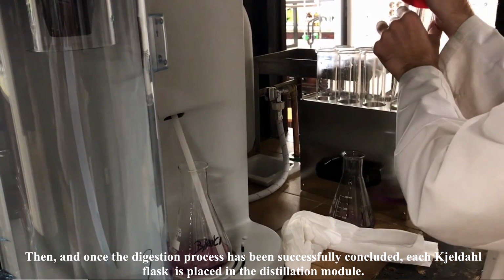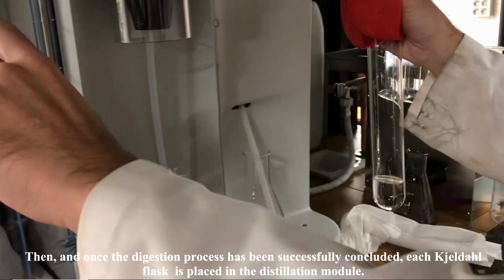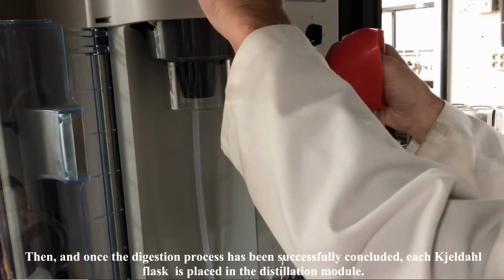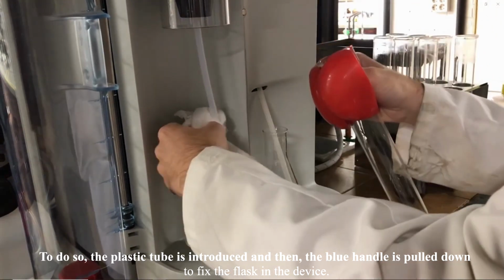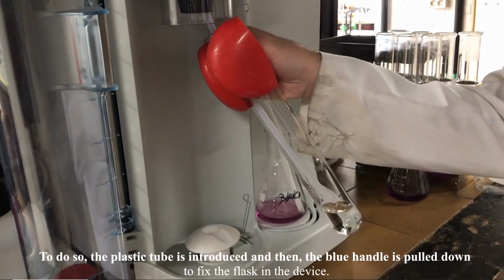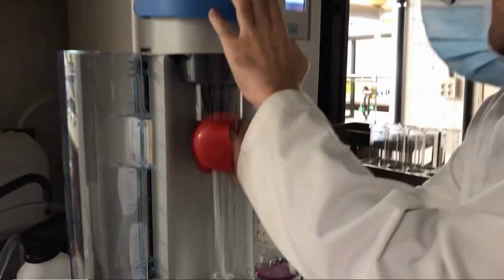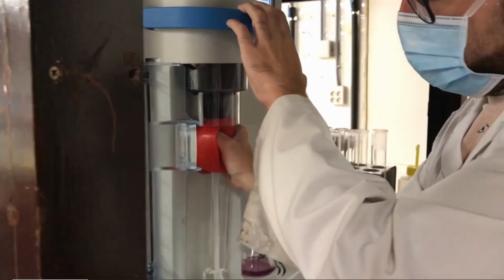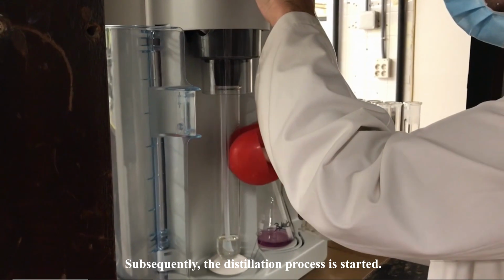Then, once the digestion process has been successfully concluded, each Kjeldahl flask is placed in the distillation module. To do so, the plastic tube is introduced and then the blue handle is pulled down to fix the flask in the device. Subsequently, the distillation process is started.